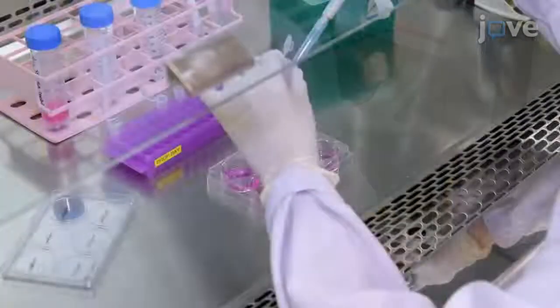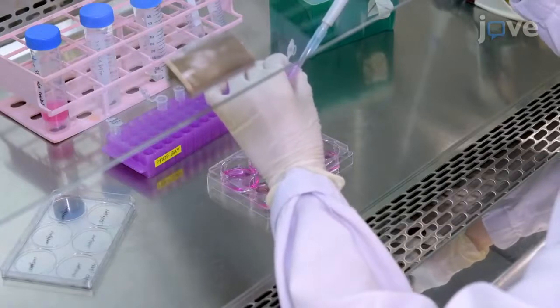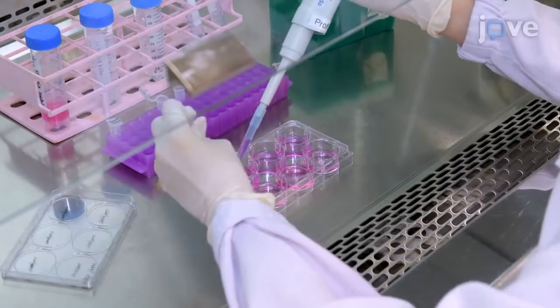After 1 day, treat the cells with 2 mL of zinc oxide nanoparticles for 8 hours, 16 hours, or 24 hours.